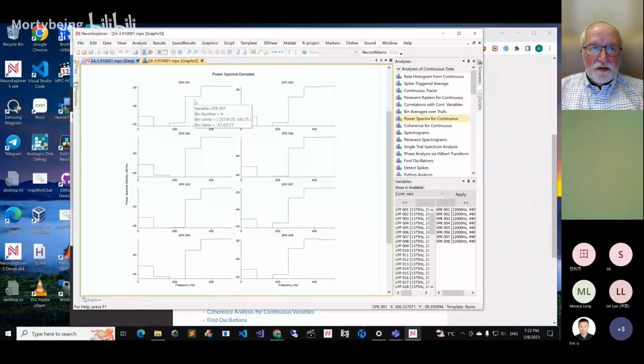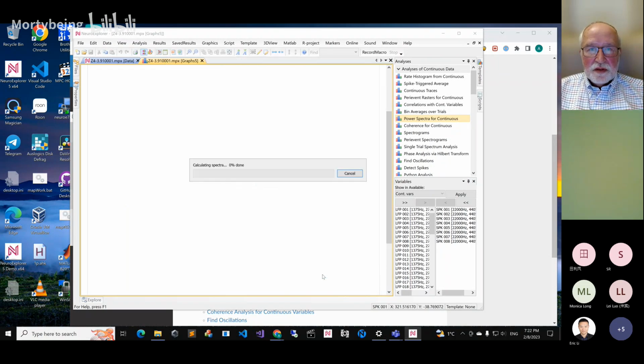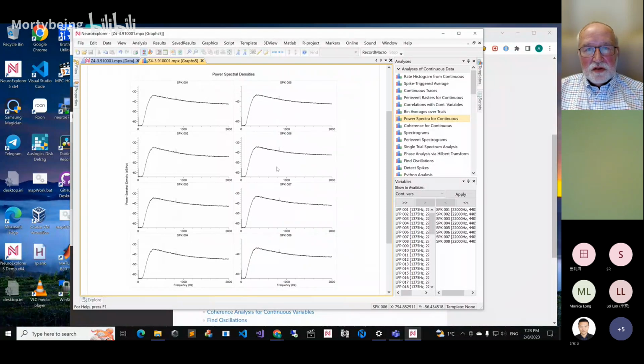So you see you have very wide bins for the frequency. If you want a high resolution in frequency, you want more values in the first parameter, number of frequency values. Now you have this spectrum value for a lot of frequency values. And the last one, usually you want to concentrate on some frequency range. So now it's 500, let's go to 2000. So this is your SPK channels and their spectra.